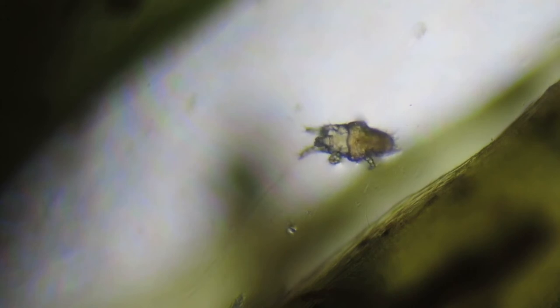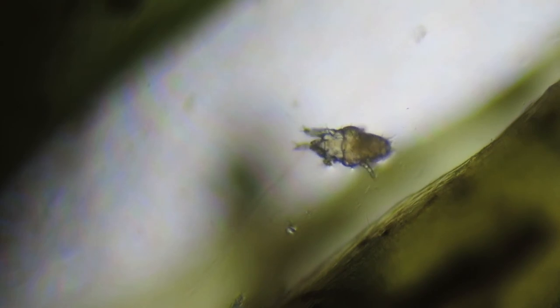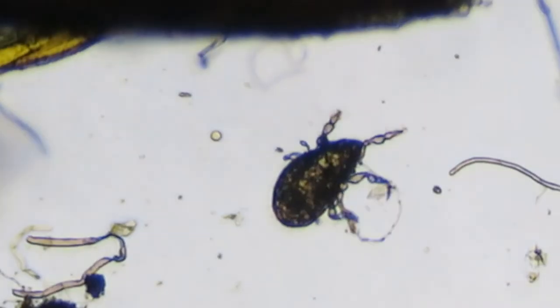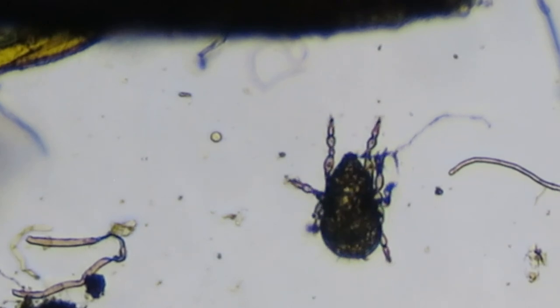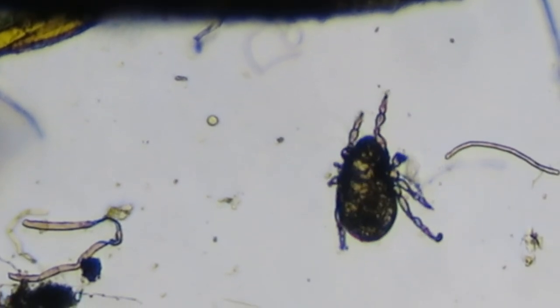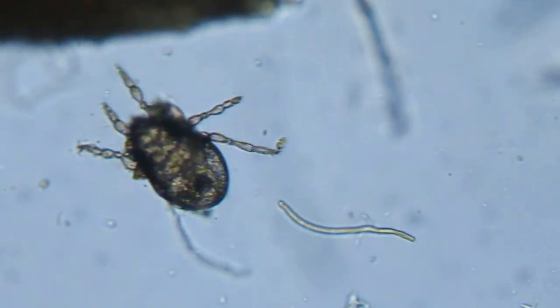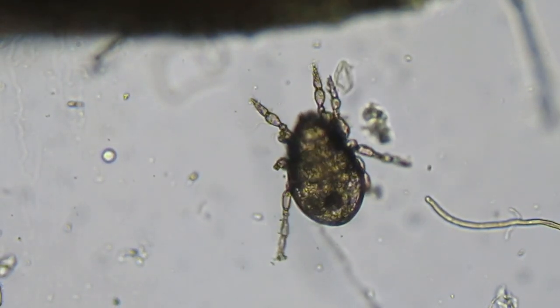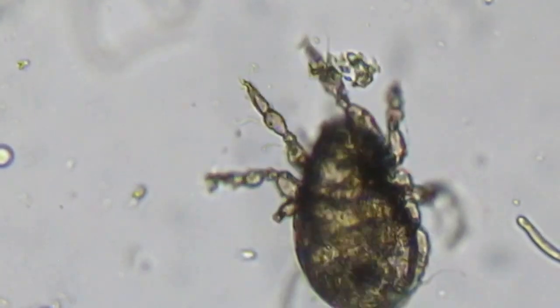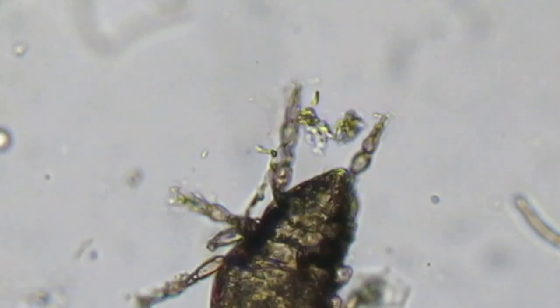Getting into some more creepy looking guys — this is a mite, related to spiders and scorpions, so it's an arachnid. We can tell because of the eight legs — four pairs of legs. Let's get a little closer. These guys are great at climbing but not so great at hanging out in the water. They do live on the water surface of the moss but this one is obviously submerged. You can see at the ends of his feet he's got little tiny hooks that he uses to grab on and hang onto the moss.